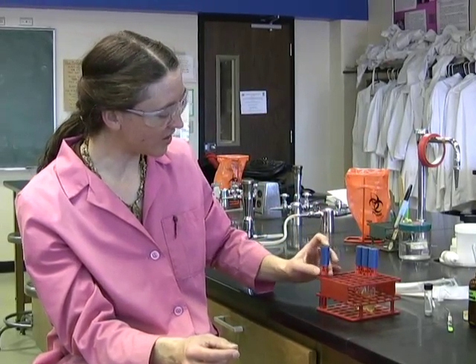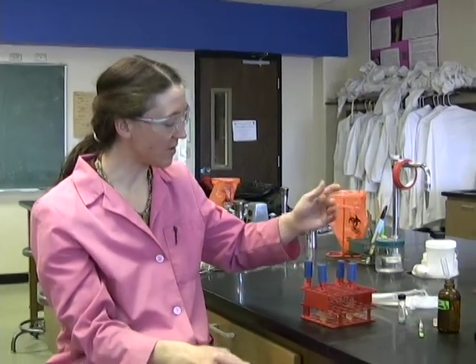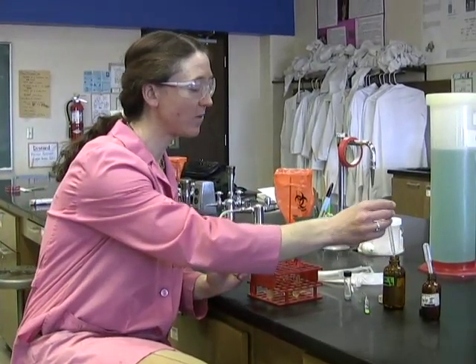Let's look at a reaction that can be positive the second way, which is if you add nitrate 1 and nitrate 2 and you see no color change. It could mean that the organism has reduced the nitrate to nitrite and then kept on reducing it to some other nitrogenous compound, maybe even nitrogen gas. Let's look at one where that's the case. In fact, this is Pseudomonas aeruginosa. In this case, we're going to add nitrate 1.